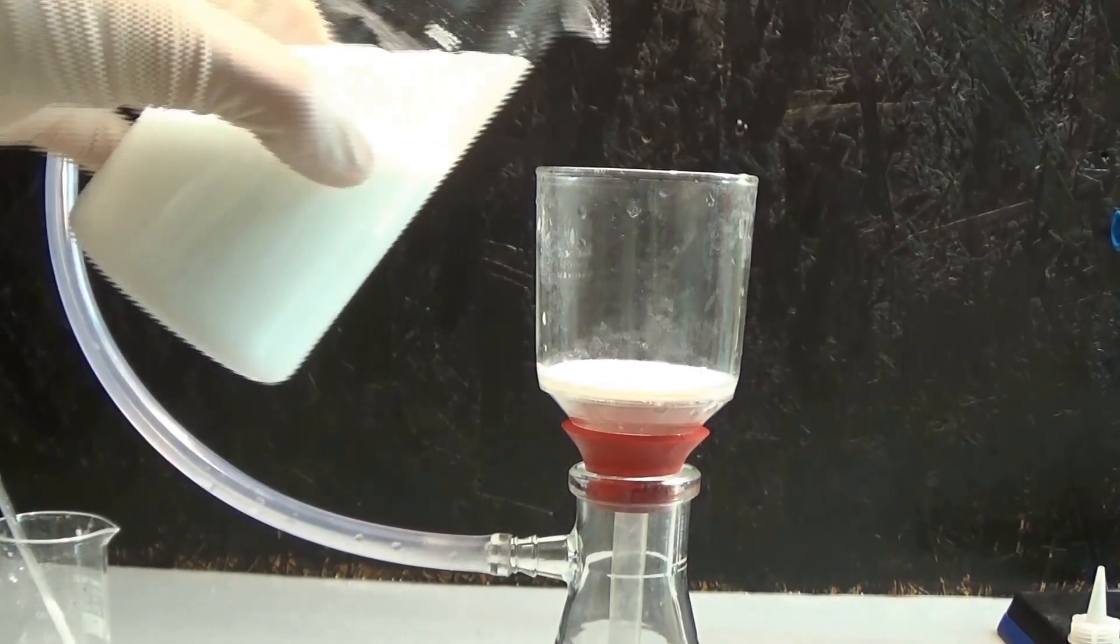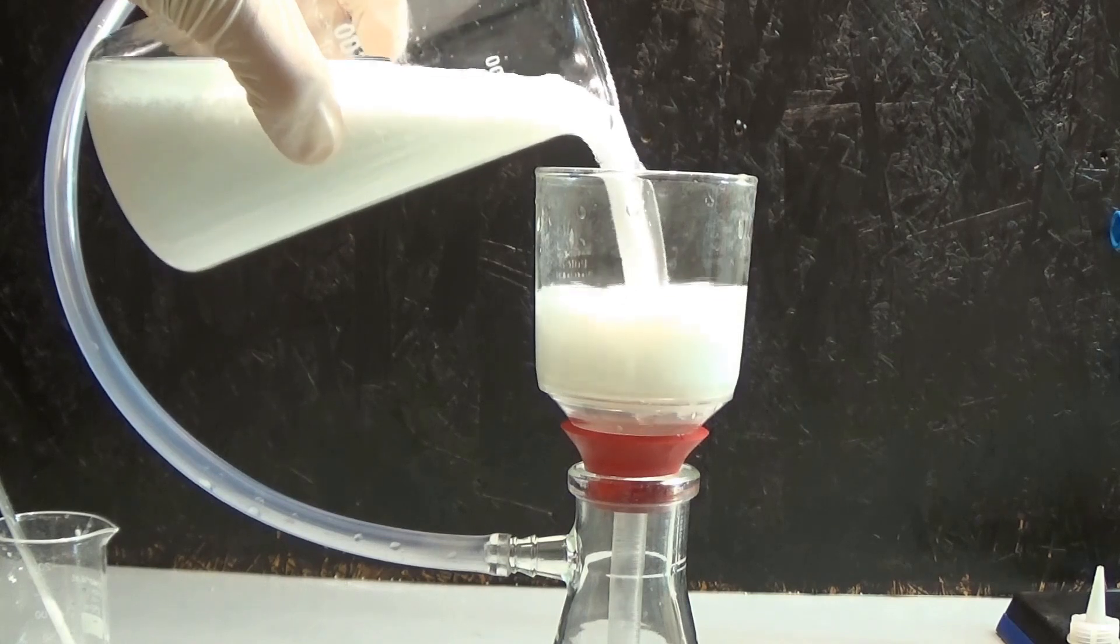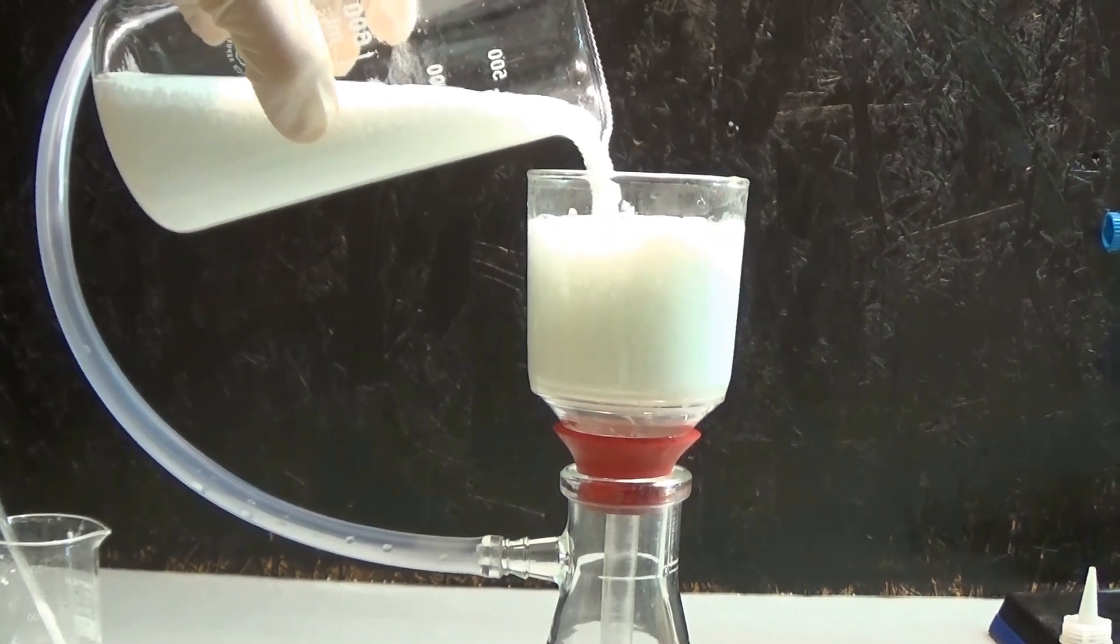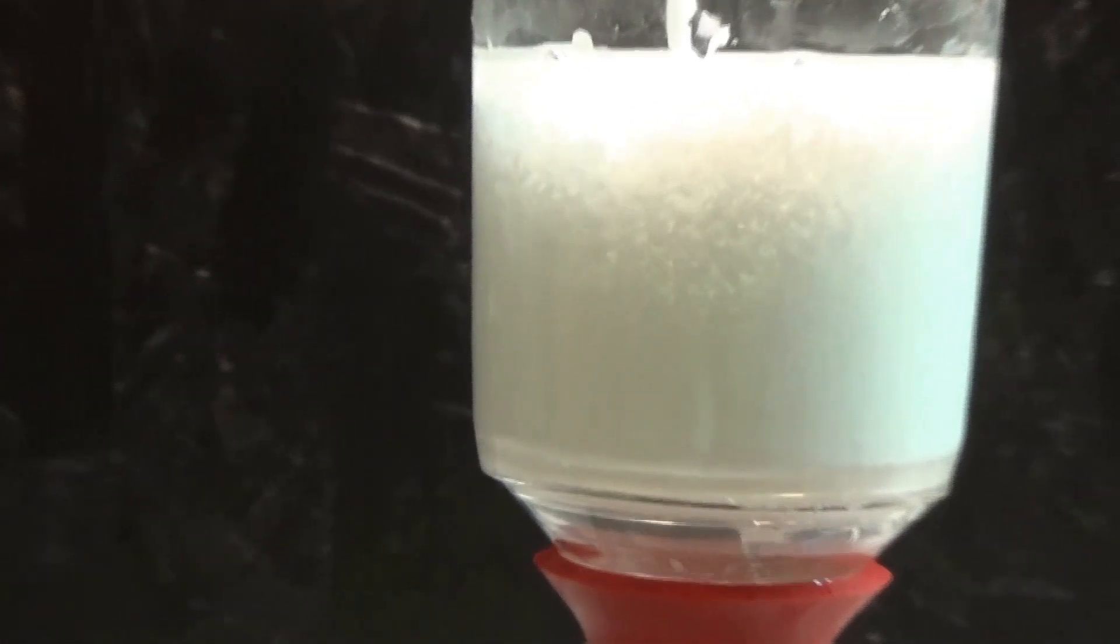I then filtered the lead chloride off and washed it several times with cold water to get rid of excess hydrochloric acid and acetic acid.